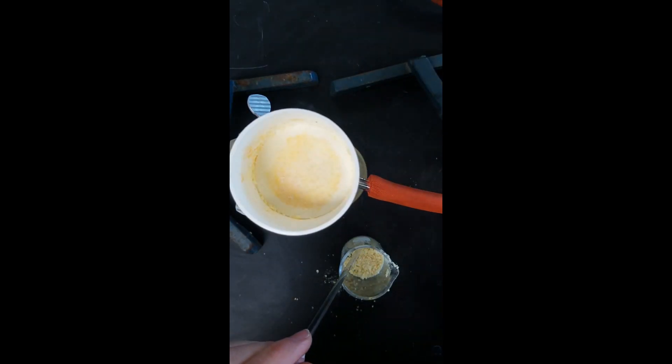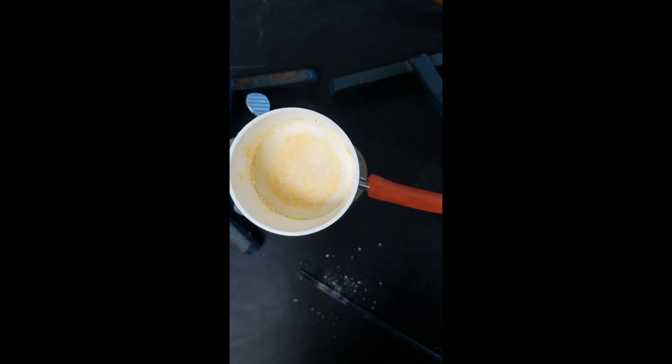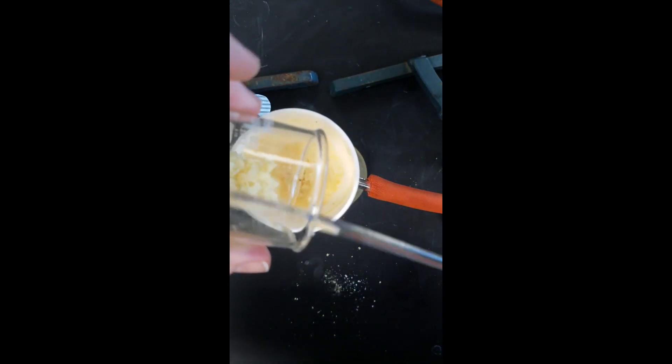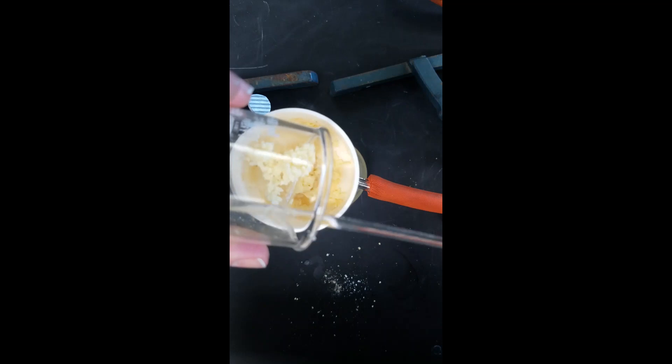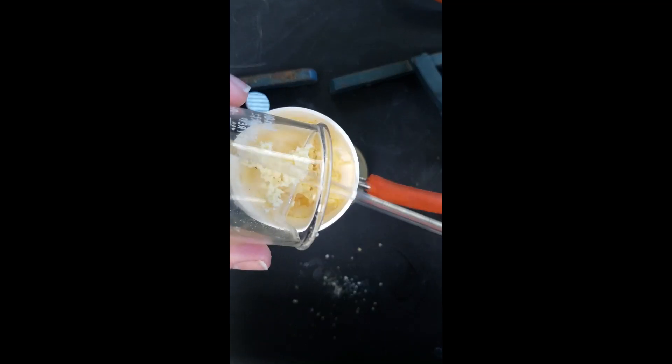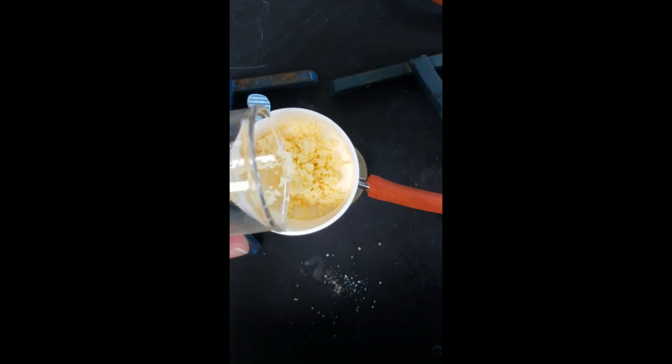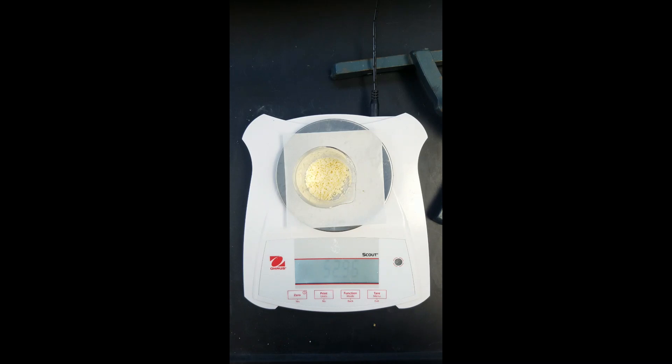Third and final addition of petroleum ether. Final filtration. The final weighing of our Pringles.